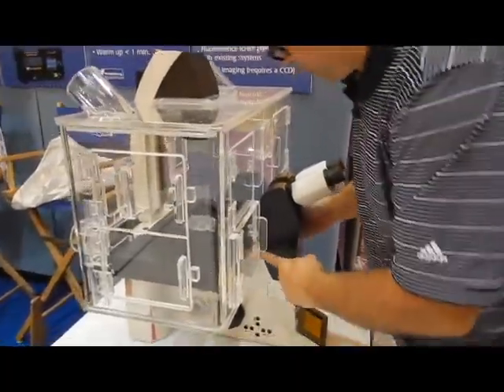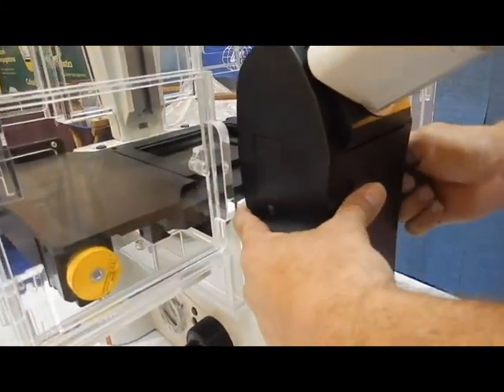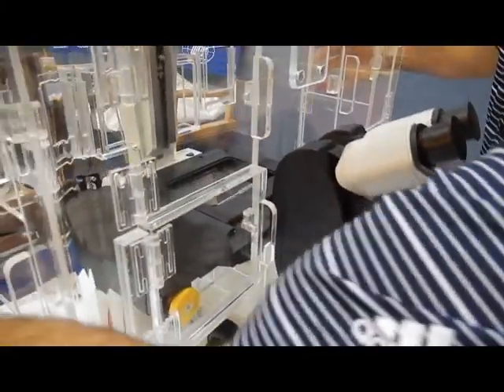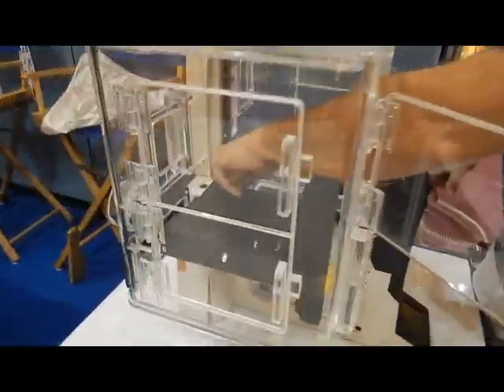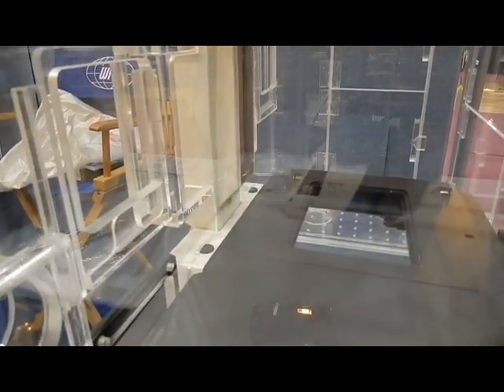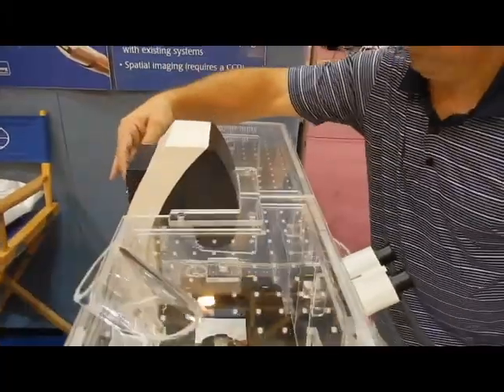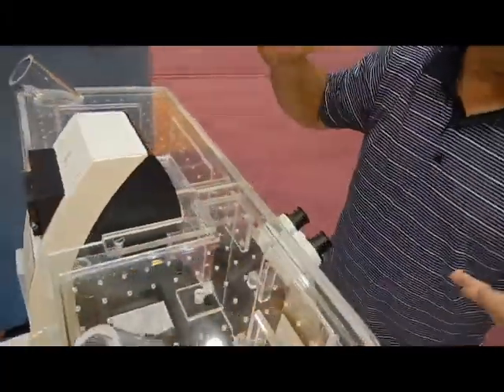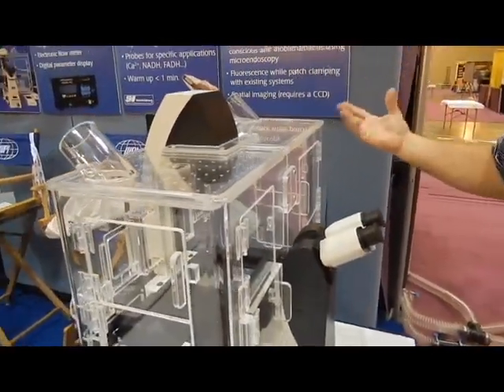When it is assembled, the front of the enclosure should sit behind the head of the microscope. The inside face of the back wall should be positioned so that it is flush with the front of the illuminator arm of the microscope. Do not be concerned about any minor gaps where the enclosure meets the microscope because all of the air in the chamber is directed up from the bottom of the enclosure.